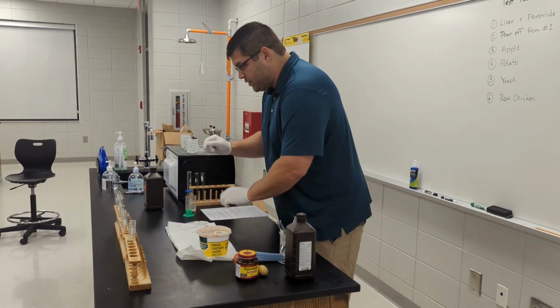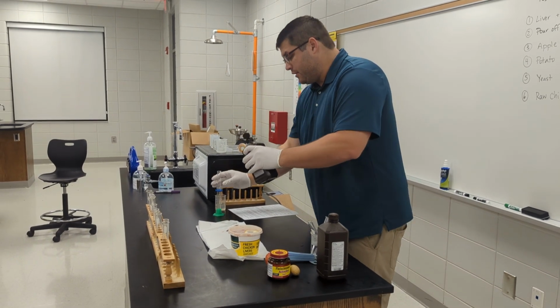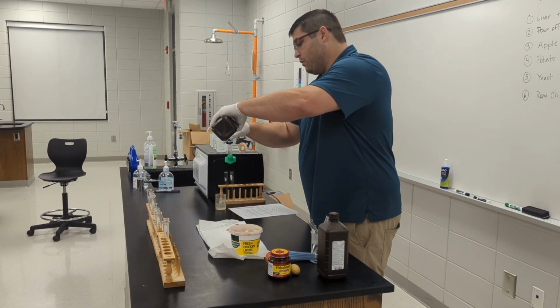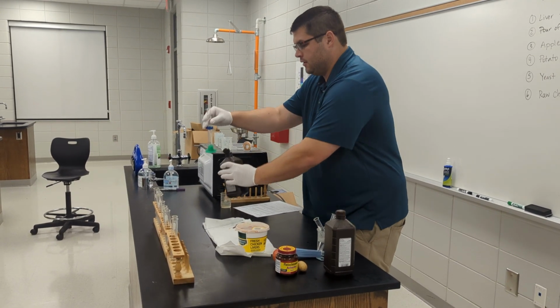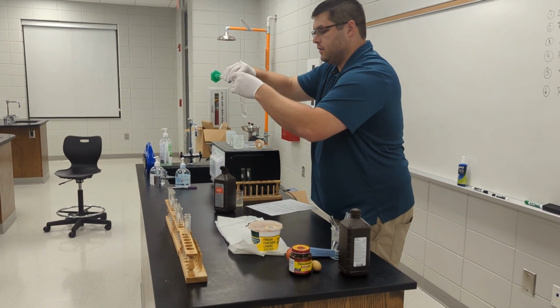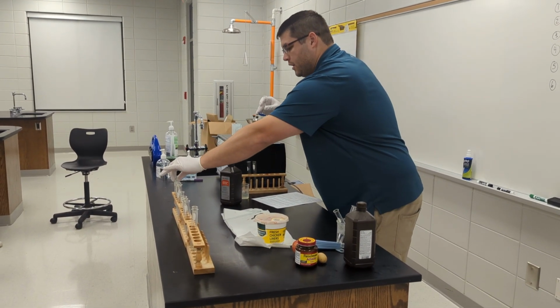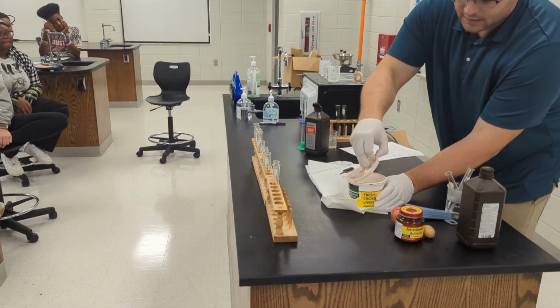So what we're going to do is in test tube number 1, I'm going to put in 2 milliliters of peroxide, all right, into your test tube number 1. And we're going to observe what happens when we put liver in there.